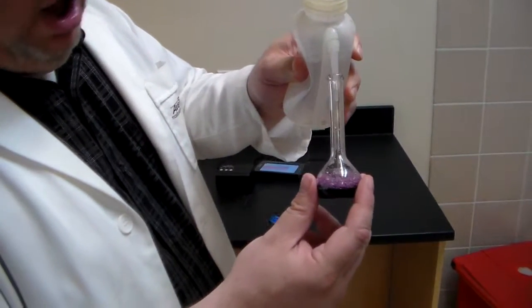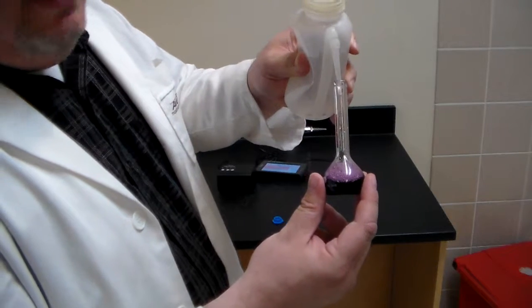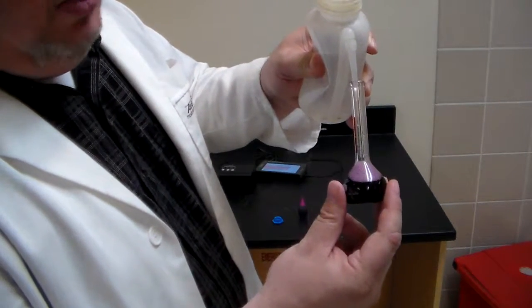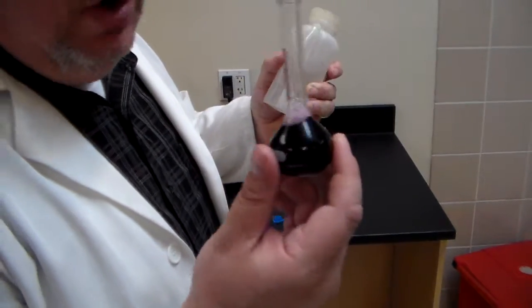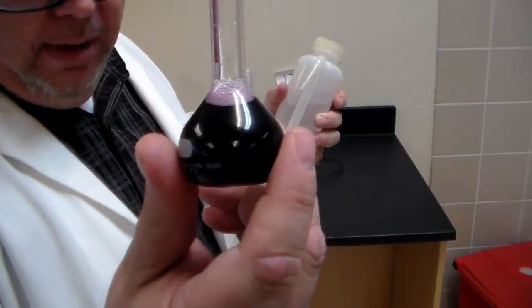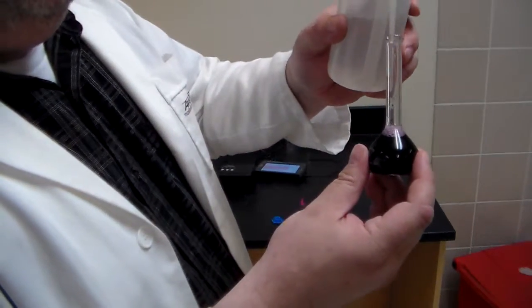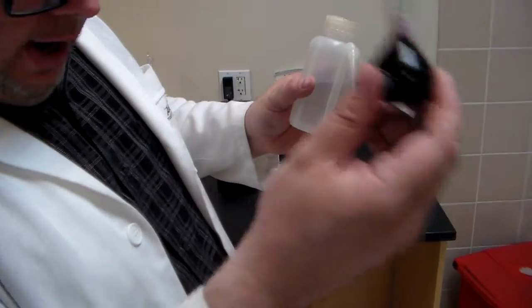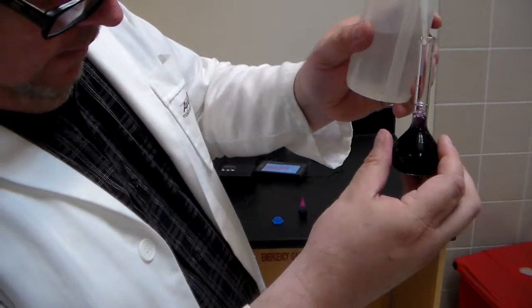This is how chemists prepare solutions, so you are learning a valid, valuable lab technique. You'd say, do we need to ignore the air bubbles? Well, we want to try to get rid of those air bubbles in there, and you kind of notice it's pretty easy to do so. All right, now we're getting closer to the end here.